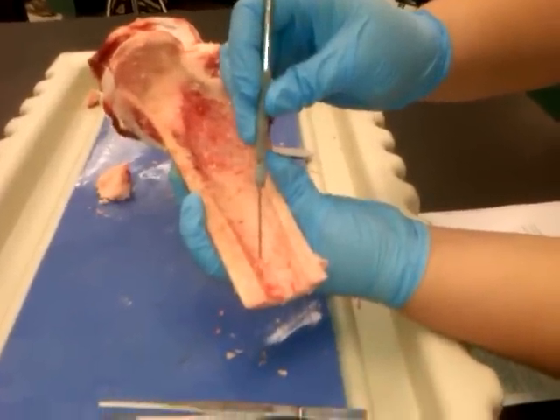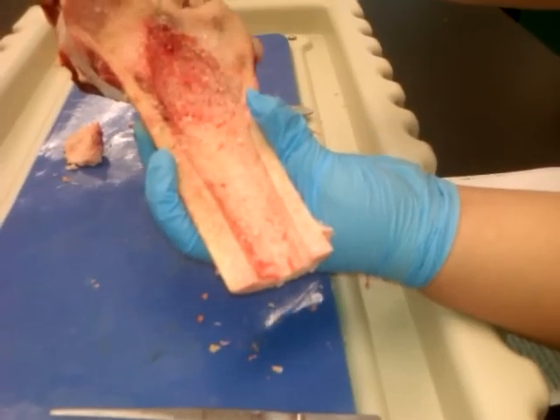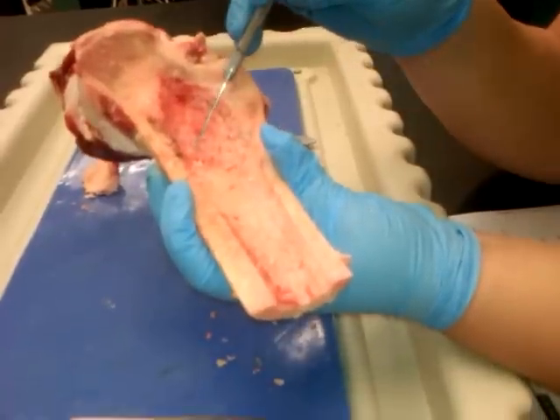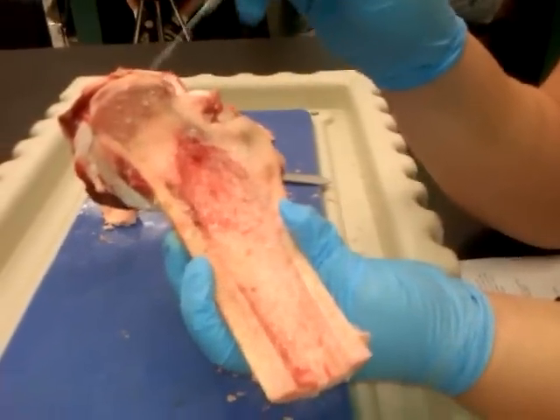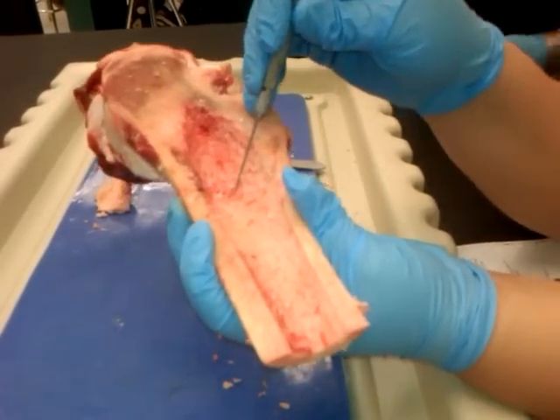Here's the site where they make the red blood cells inside of there. This is the spongy bone — or what's called spongy bone, right? Yes, that's spongy bone. Which one is it? The medullary cavity. Yeah, that.